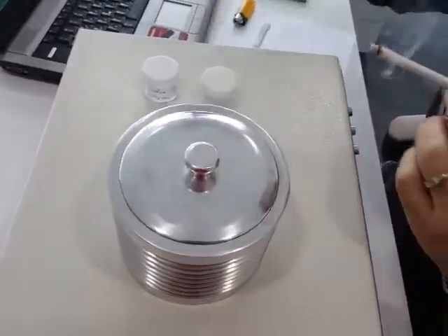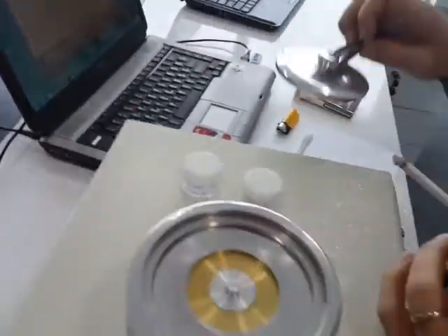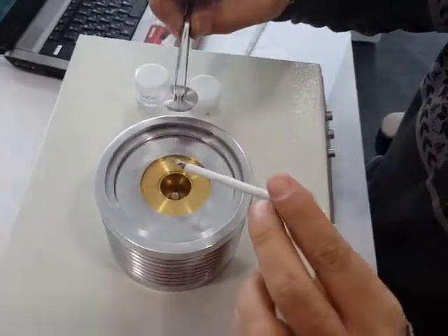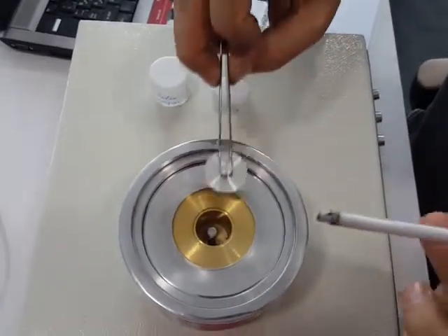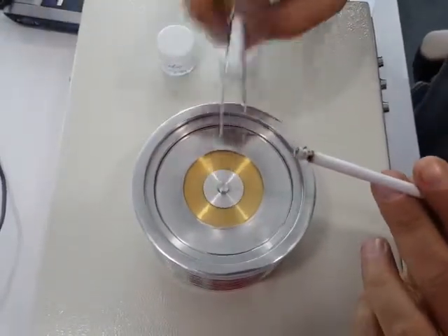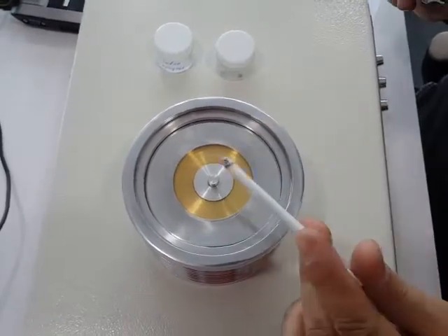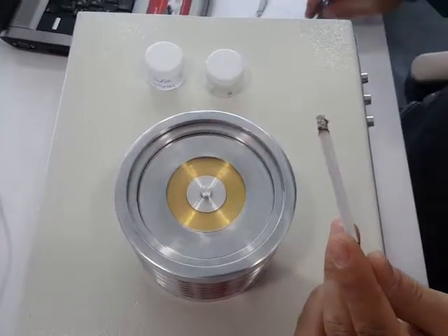After 1 or 2 minutes from opening the O2 valve, the operator can open the chamber, and when he puts it in, it will be burned. I mean, it will turn red and the cigarette will start burning. In this way, you can easily check if the oxygen is coming to the chamber or not.